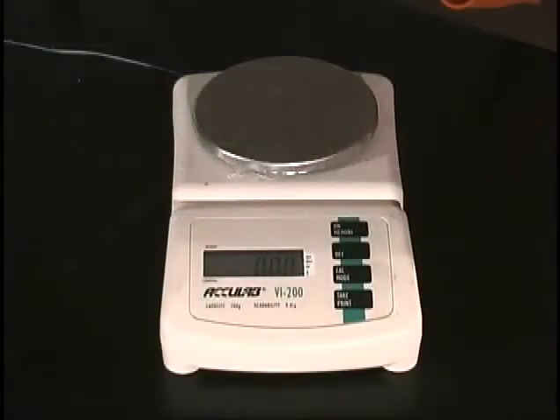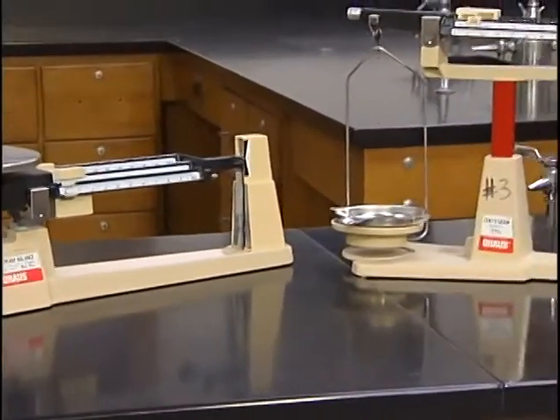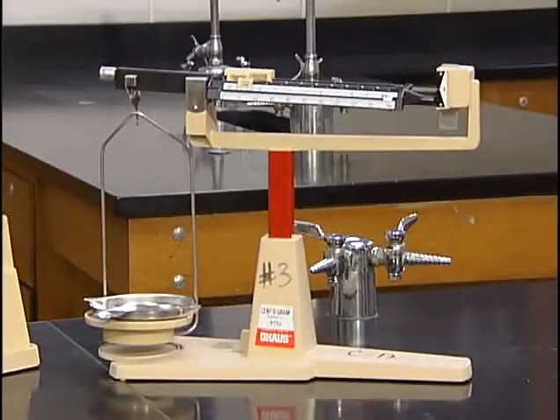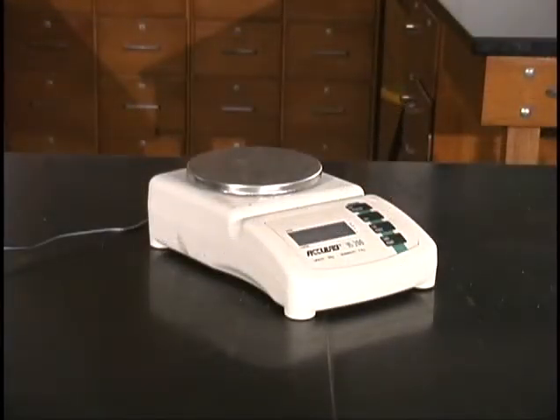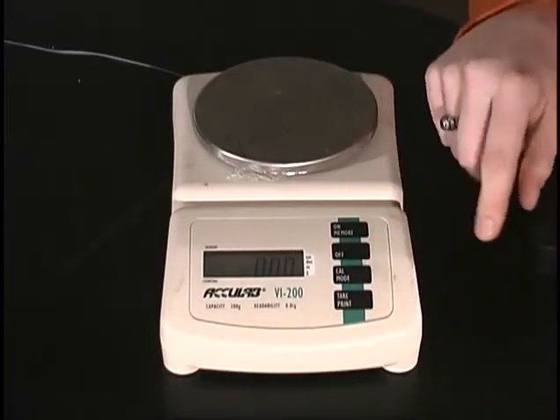The last measurement we want to practice making today is the mass measurement. There are many different kinds of balances. You have probably used a triple beam balance in a middle school science class. There's a good chance that you will be using a triple beam balance when you do labs in your schools. Another type of balance is a digital balance, which is easier to use. We will be using a digital balance for the labs performed on the video programs. The digital balance we will be using in our labs measures to the hundredths place. Let's learn how to use it.